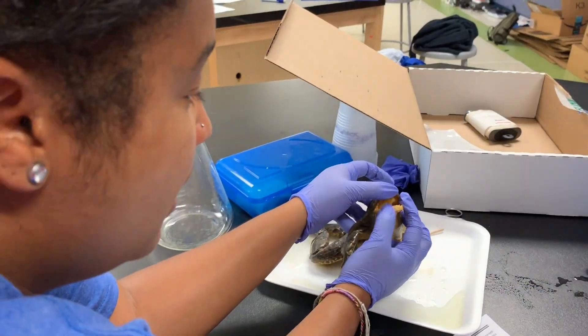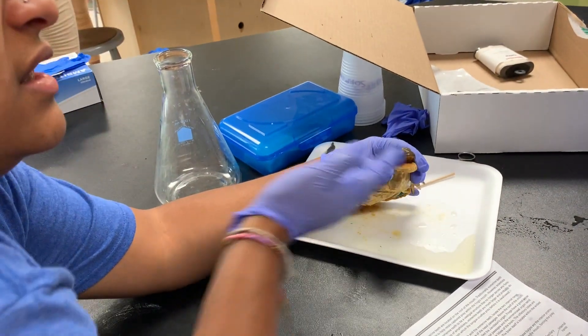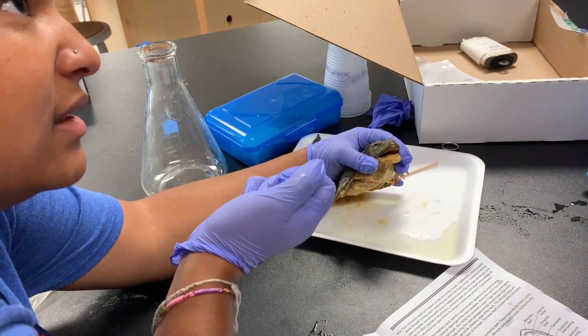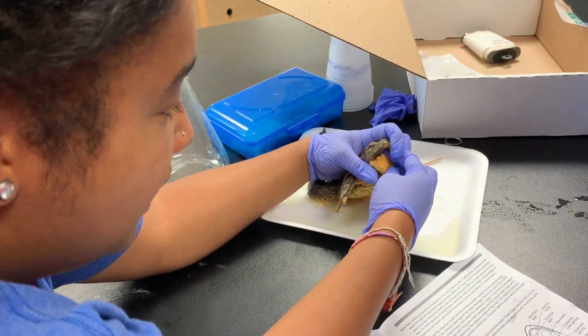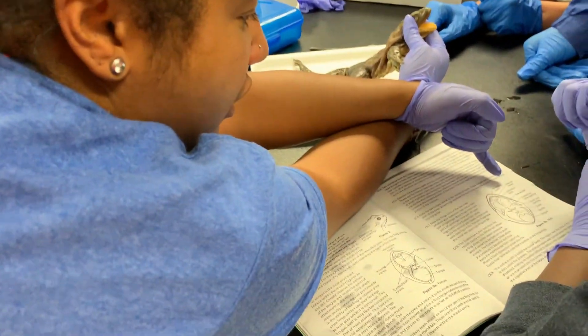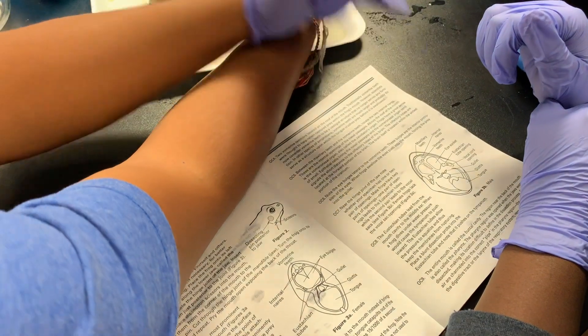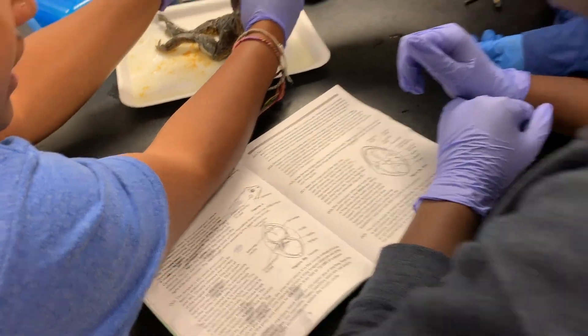You can actually visualize that in here. Another misconception about frogs is that we think they stick their tongues out to grab food like this, but really their tongues unfold to get there. If you look at your diagram, there are teeth right here. What are those called? And what about those two little ridges on the inside?